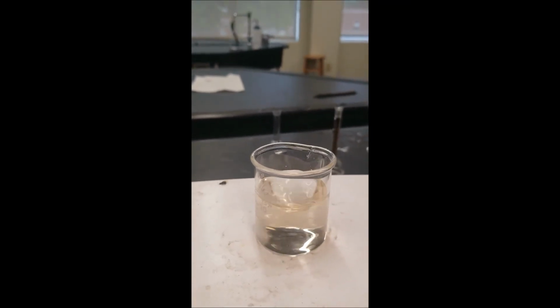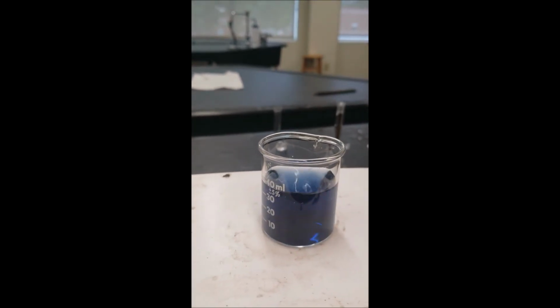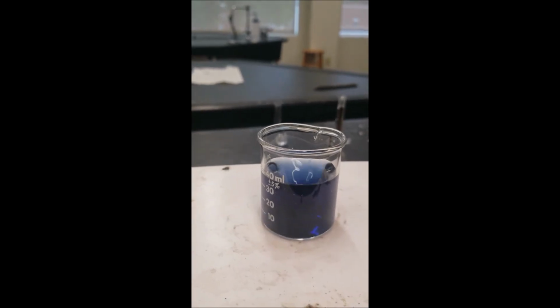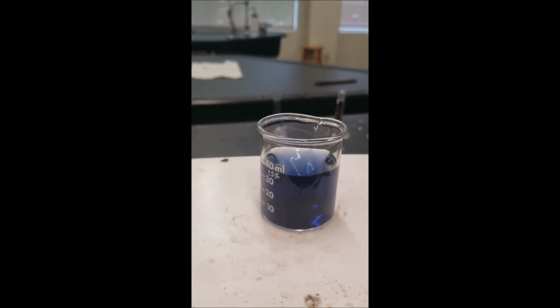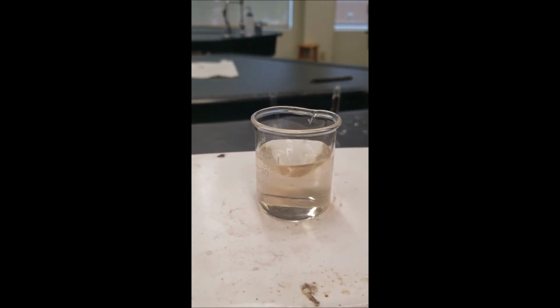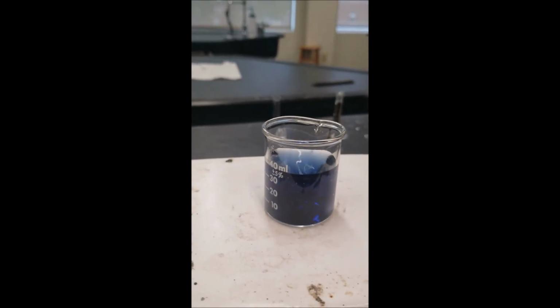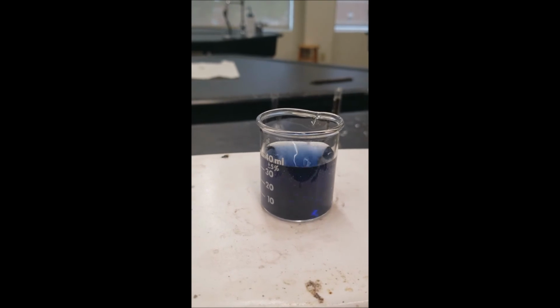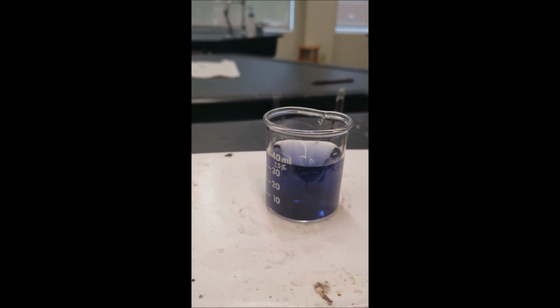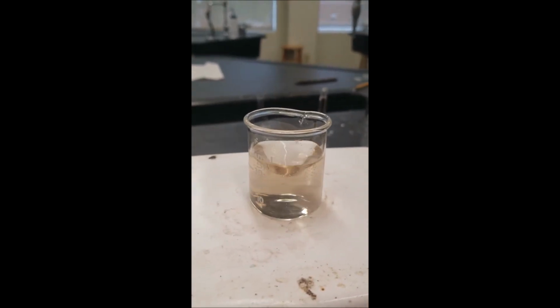Here we go. As you see, it cleared out, reformed amber, and that's now begun to oscillate. Very slow at start. So that manganese is there to help ease the oxidation, but the malonic acid is there to help remove your iodine starch complex and get us back to the starting point again. So without those, we will see absolutely no oscillation.